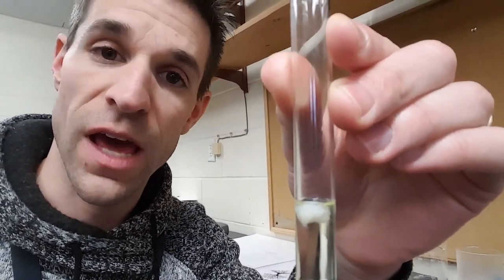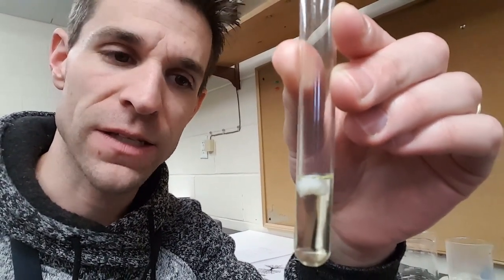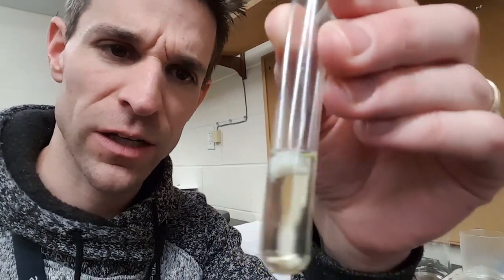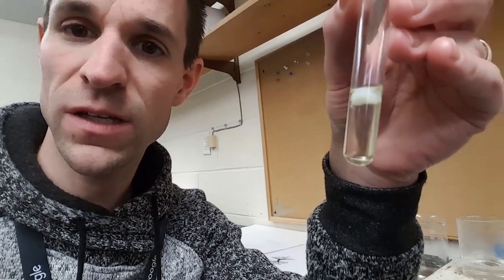Okay, we're back. And now I have a new test tube with some new DNA in it. There's our DNA harvested from the bananas. And I put as much in here as I could possibly find in some of those leftover beakers that we had at the end of class. So a lot of DNA in here. I put the diphenyl amine in here and a little bit of water, just like the protocol says.